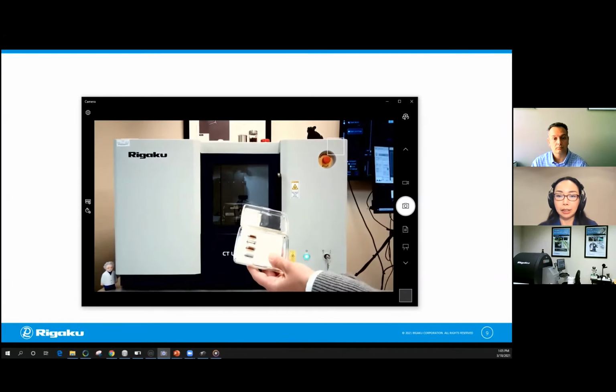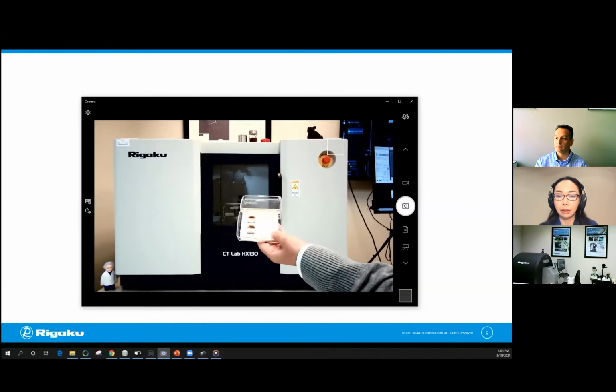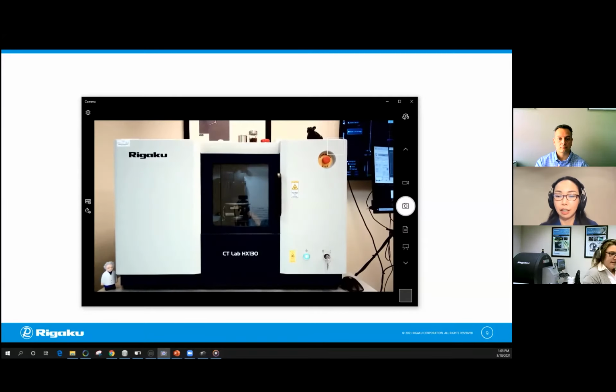It's pretty split, actually. We'll see. I'm going to give you a few more seconds to think about it. So Angela is showing you different filters you can choose from. Okay. And I also showed you that the sample is 50 millimeters. So the 50 millimeters is going to be our field of view.